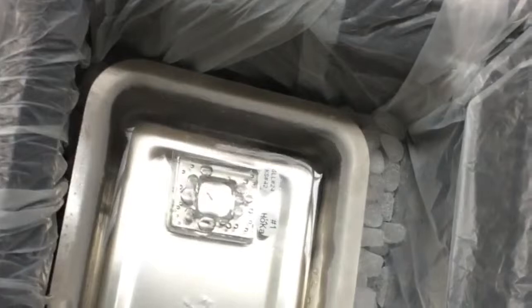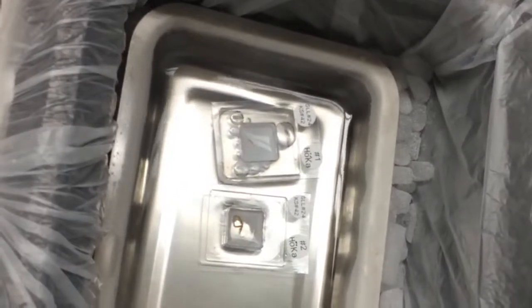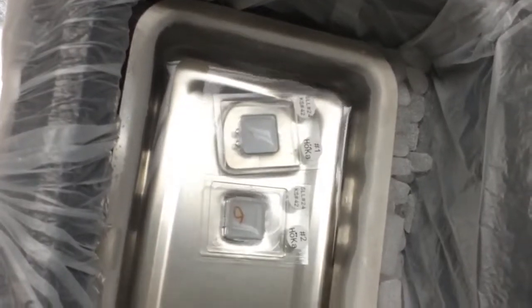Next, place the samples in a tray filled with 99% ethanol and place the tray onto dry ice. Once the OCT has become solid, transfer the fresh frozen biopsy to minus 80 for storage.